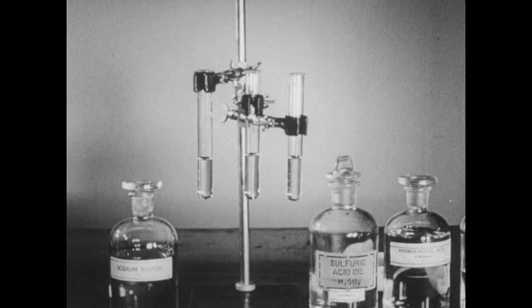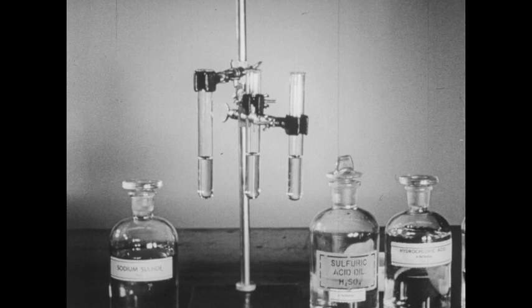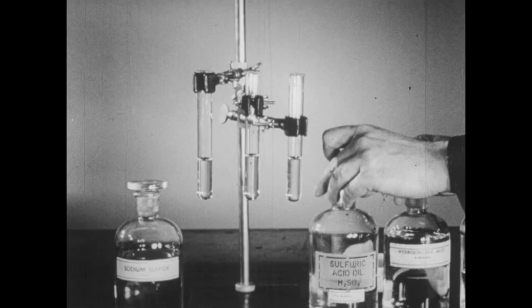We turn now to the gas which is formed when hydrogen and sulfur are united: hydrogen sulfide. We wish to study the laboratory methods for the preparation of this gas and several characteristic reactions of it. In each of these test tubes, I've placed a small quantity of sodium sulfide solution.